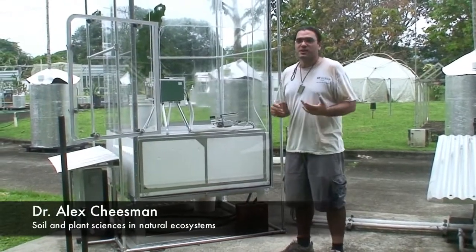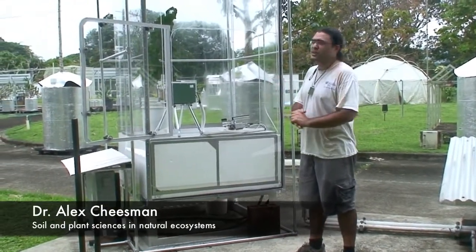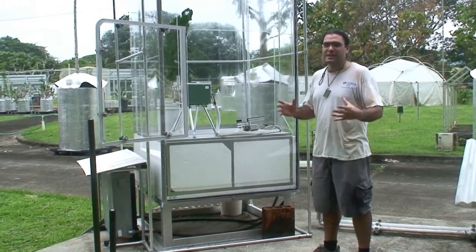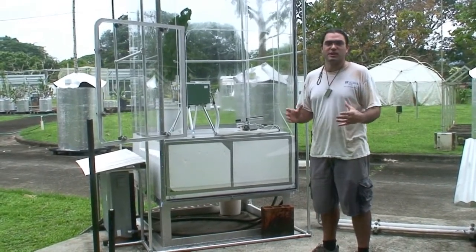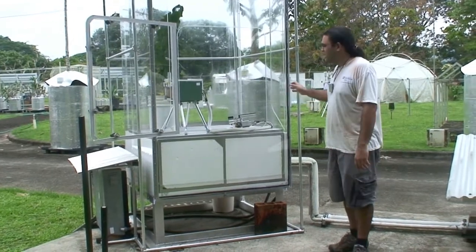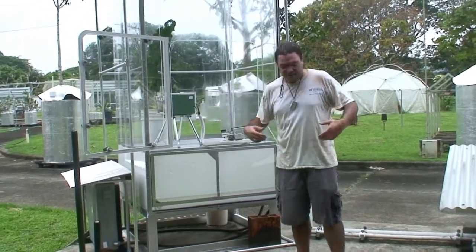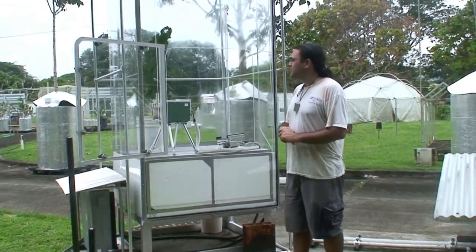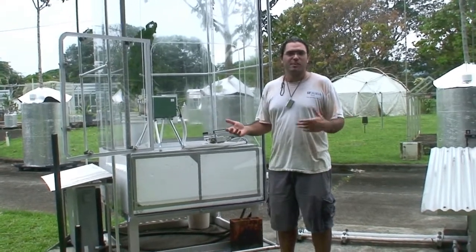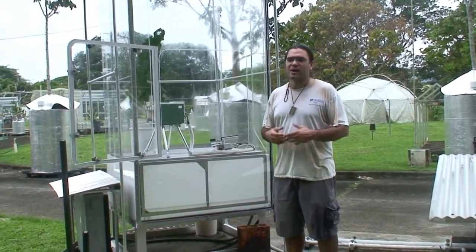This is called an EGC Daylight Growth Chamber. It's basically a big air conditioning unit with a perspex box built on top of it. As you can imagine, it's rather hot here in Panama — I'm sweating quite a lot. Current air temperatures around here are about 34 degrees centigrade.